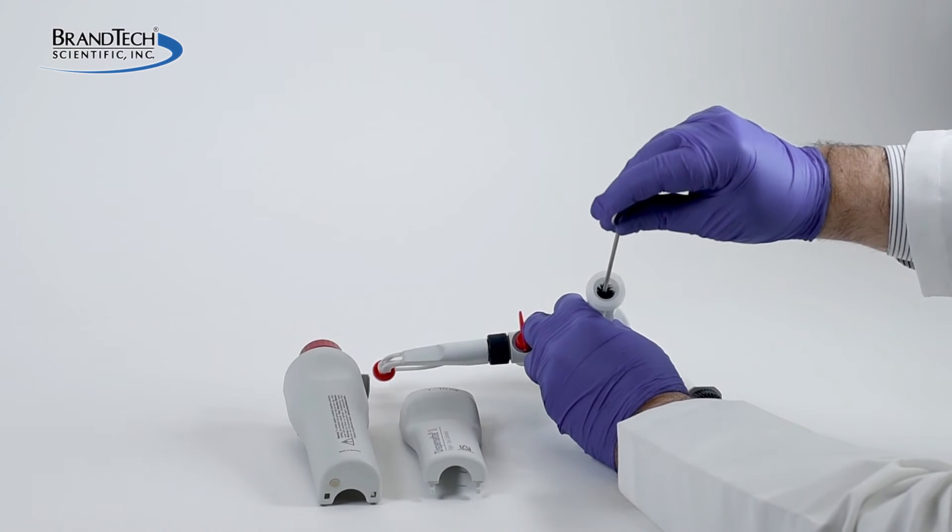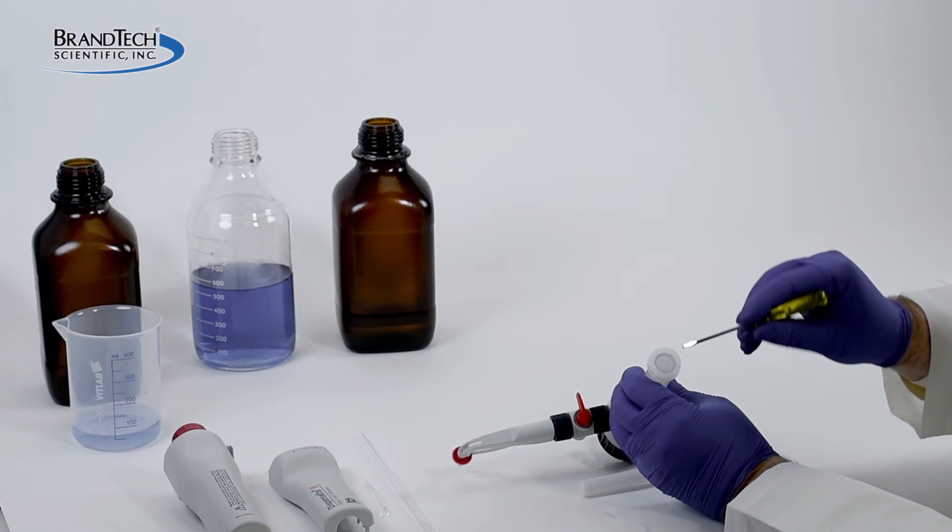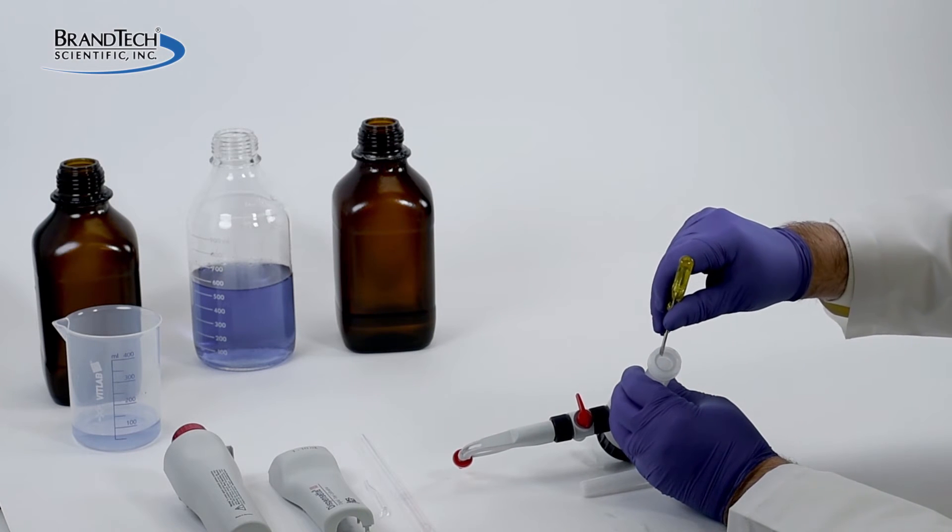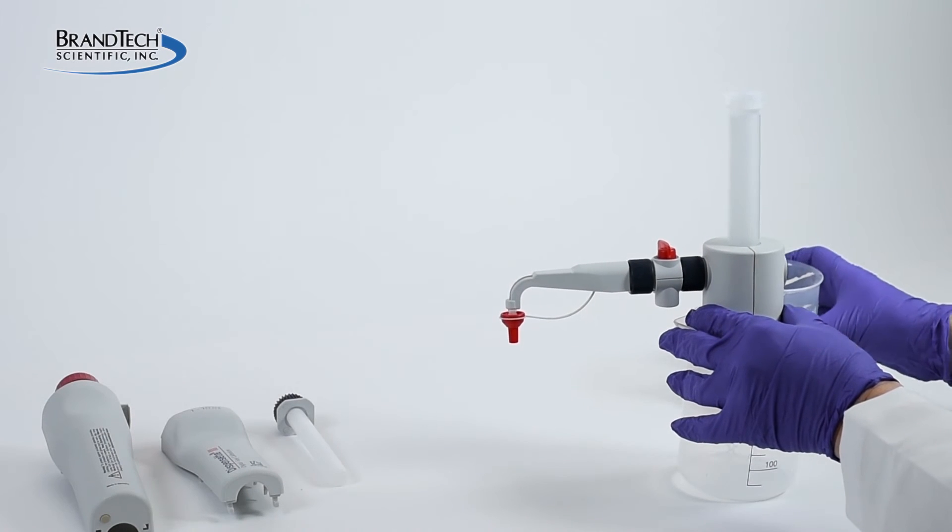Clean the piston and the cylinder with a soft bottle brush. If there are crystals at the top of the cylinder, they can be scraped away. Do not scrape on the inside of the cylinder. Flush the inside with deionized water.